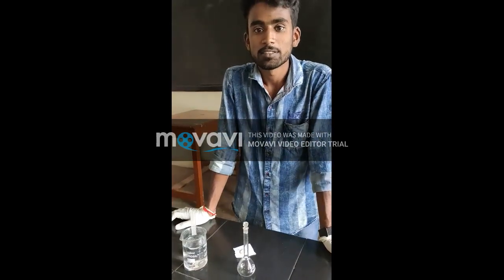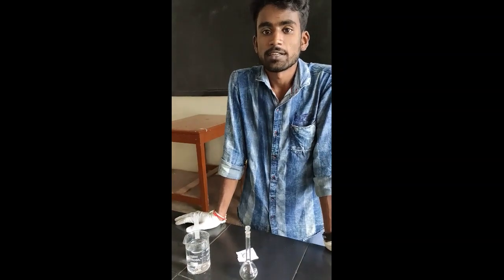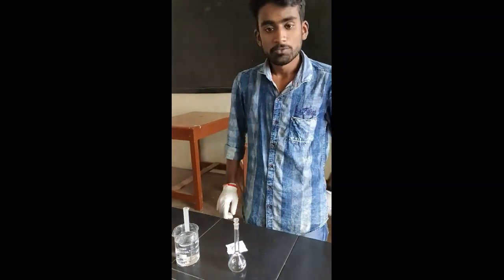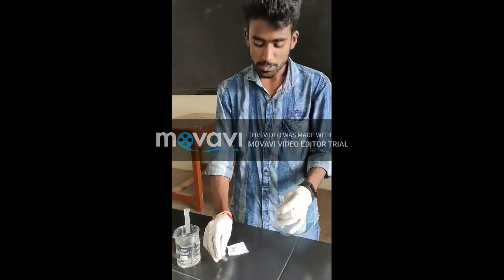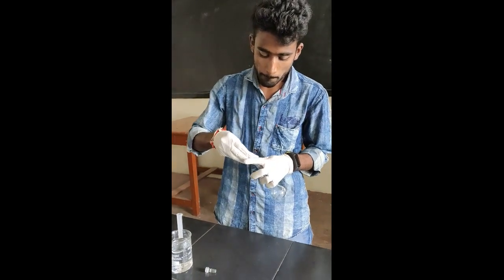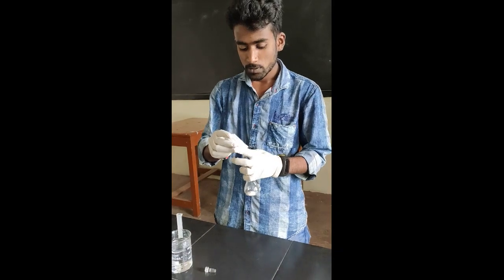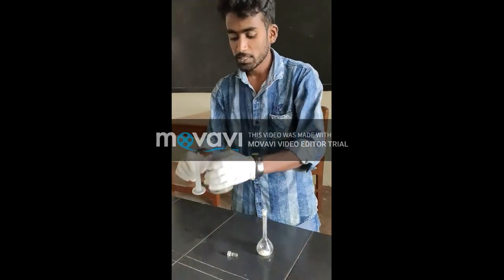Now I am preparing carrageenan 0.1% paw edema volume. I am taking 50 mg in 50 ml distilled water and adding the carrageenan into the container.